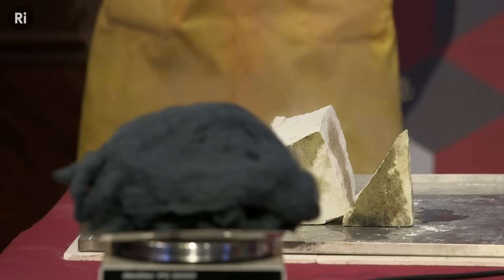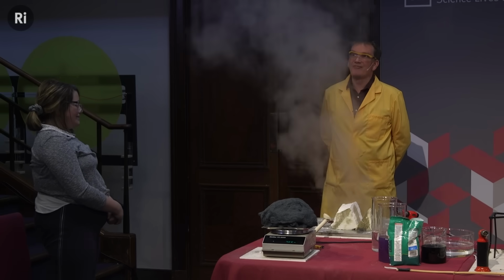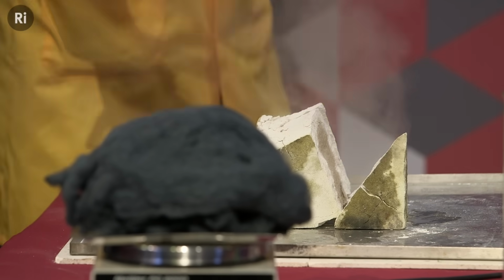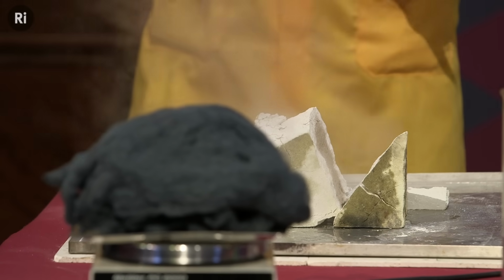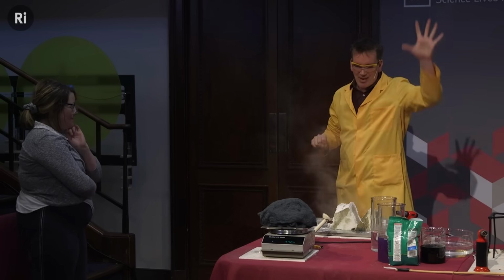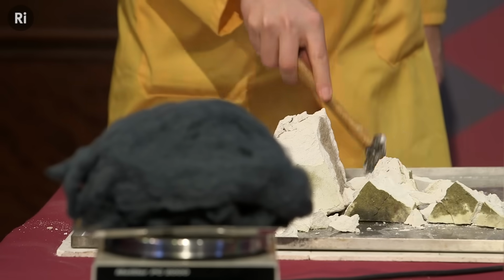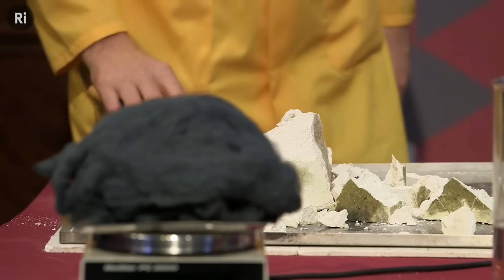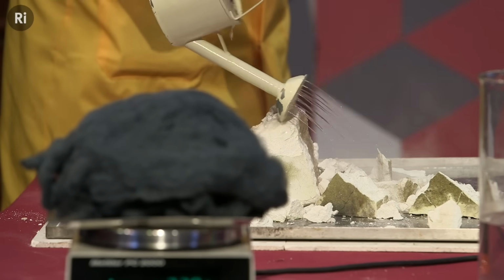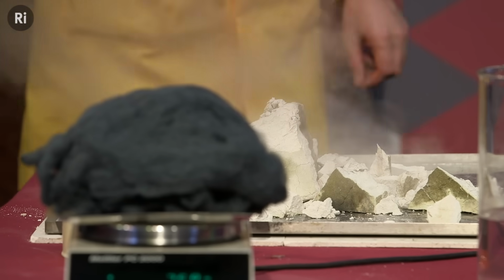Okay, so far. Now, it was cold, and the water was cold, and a violent reaction is taking place. In fact, this reaction is so violent that this is steam being given off. And the reason I had to ask you to step back is because actually little bits can ping off of this sometimes. It really just depends. So now it's much flakier. I'll add a bit more just to get it right in there. So the substance was lime.